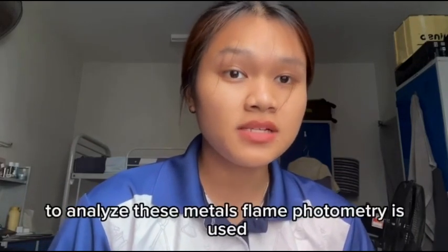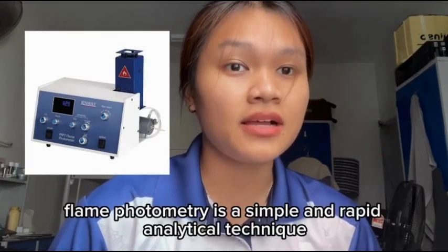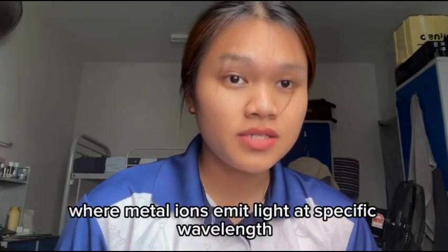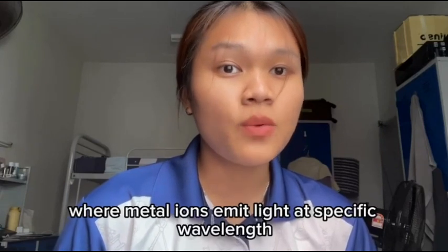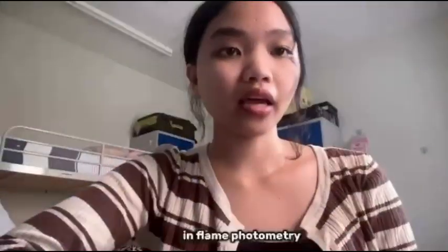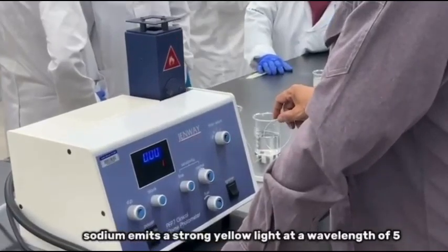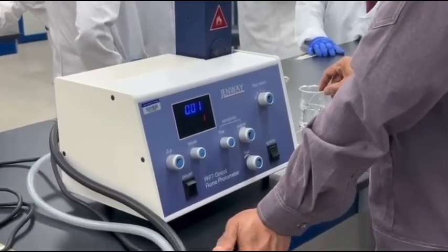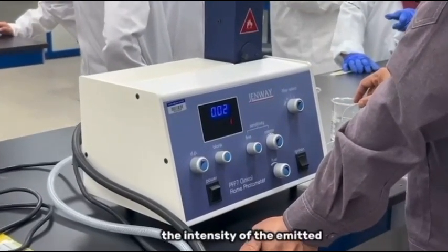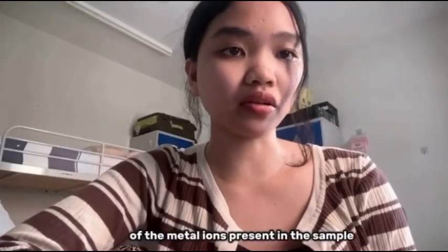To analyze these metals, flame photometry is used. Flame photometry is a simple and rapid analytical technique based on emission spectroscopy, where metal ions emit light at specific wavelengths when introduced into a flame. In flame photometry, sodium emits a strong yellow light at a wavelength of 589 nanometers, while potassium emits light at 766 nanometers. The intensity of the emitted light is directly proportional to the concentrations of the metal ions present in the sample.